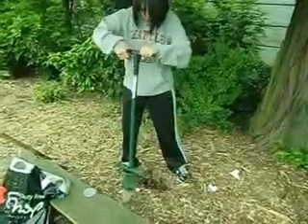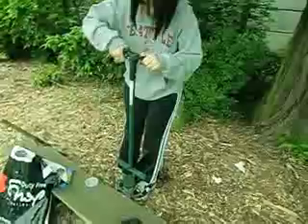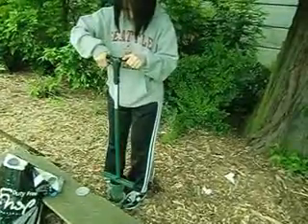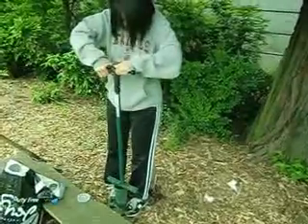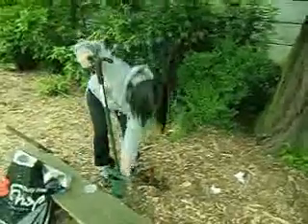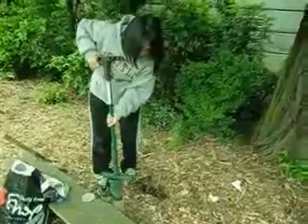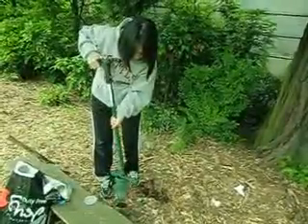Well, if you stick it in there, you can't open it, because when you open it, you want me to hold the cup? Yeah, you can get your shoes dirty. It's okay. Need some help? You sure you don't want some help? There. 20 grams, right? You just dump that in, it's fine. There we go. Okay. Perfect.